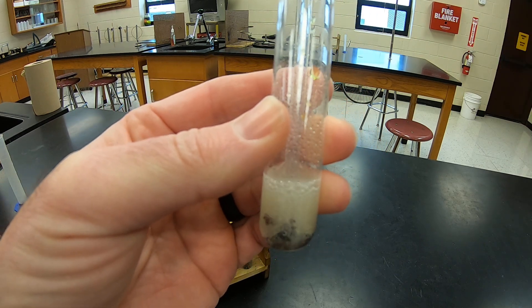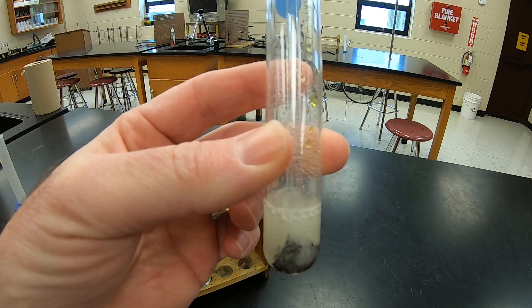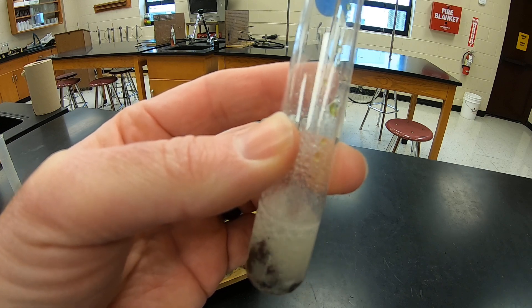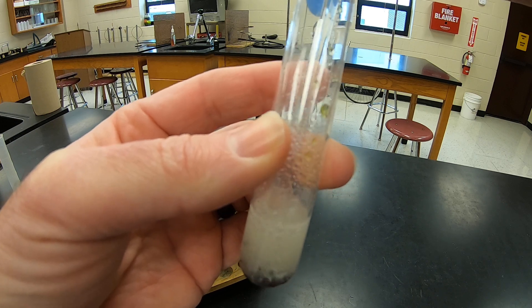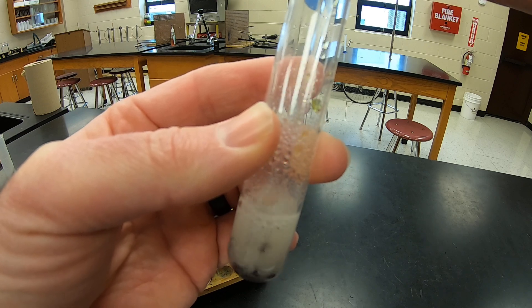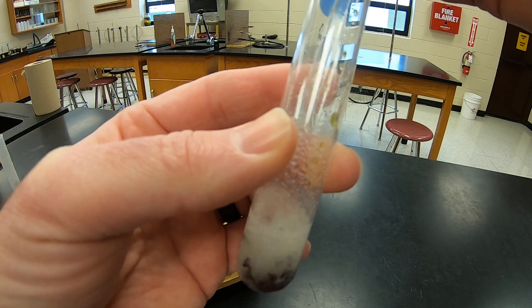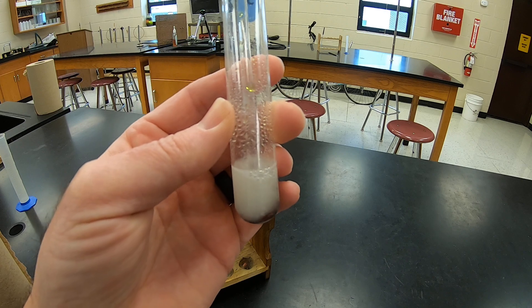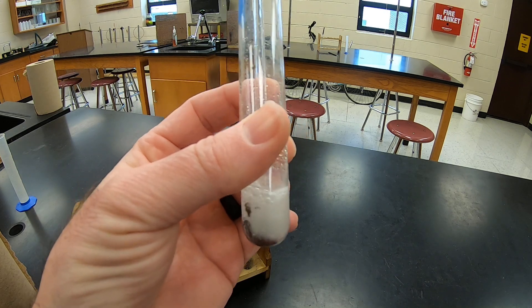You can see on the zinc we're getting a solid forming on there. There's definitely a reaction taking place — you can see there's a gas being produced. We already know what happens when zinc is added to hydrochloric acid: we get hydrogen gas being produced. If we were to light this gas, we would see that it was hydrogen gas.